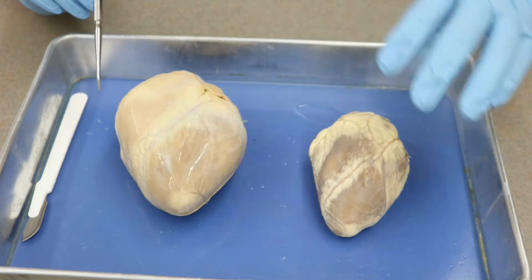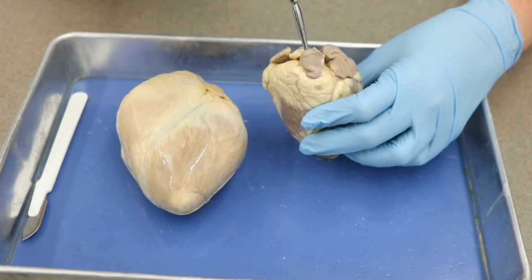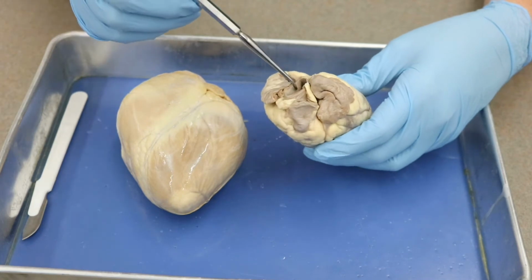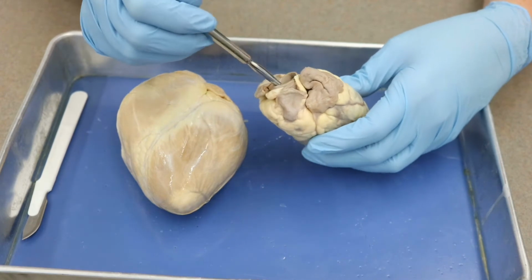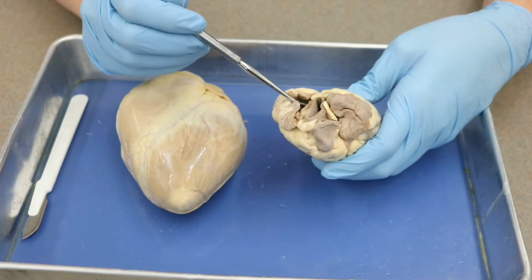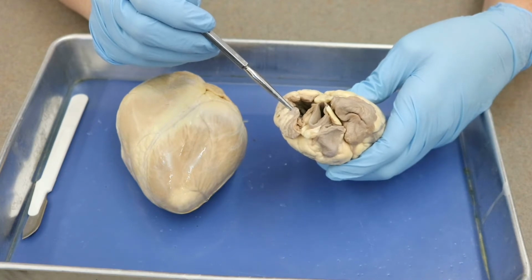But let's just go ahead and finish up by looking at those same great vessels on our sheep heart. As we're looking, we have the most anterior vessel that is coming off the right heart, and so that makes this our pulmonary trunk. Then just posterior to that, we have another vessel here, which is going to be your ascending aorta. Again, it's been cut off before we can get to the aortic arch. And this one has been cut so low that we've actually lost the vena cava. It is opening up directly into the right atrium, okay?